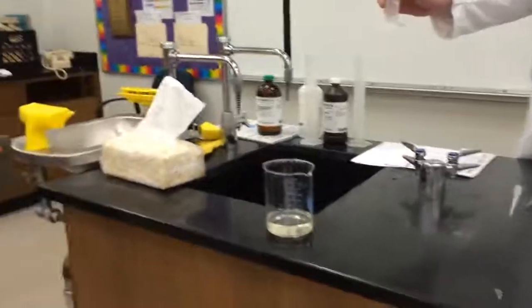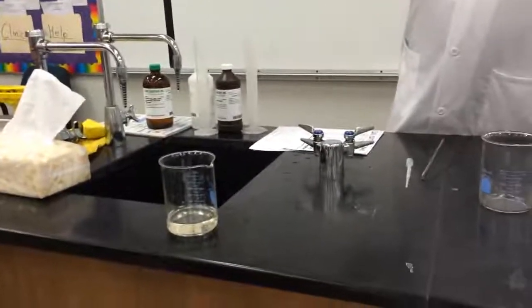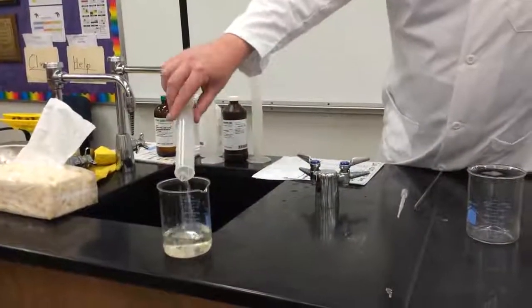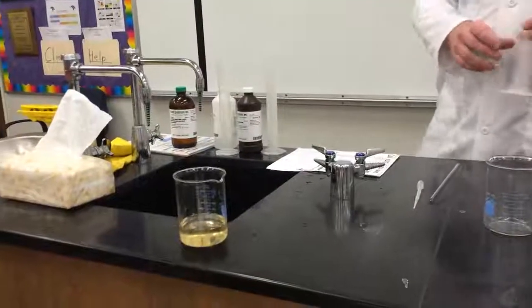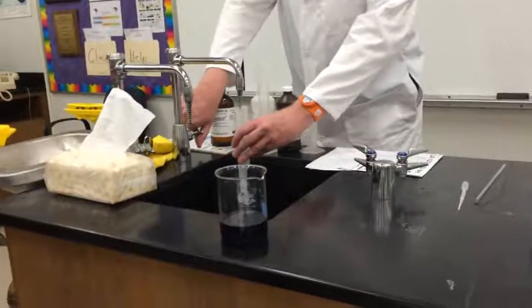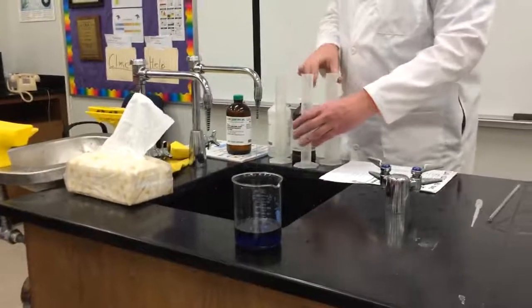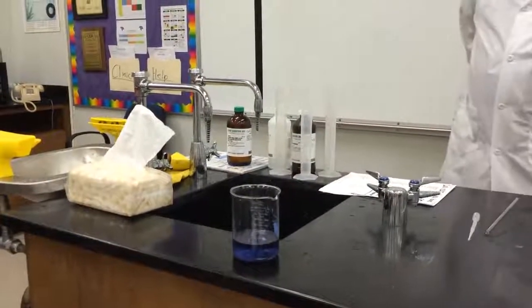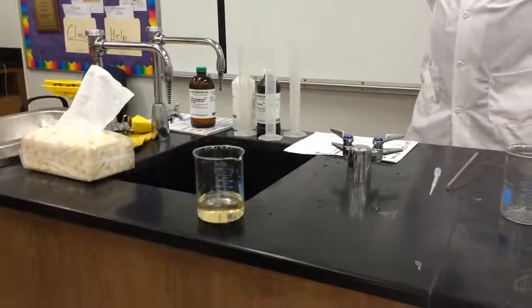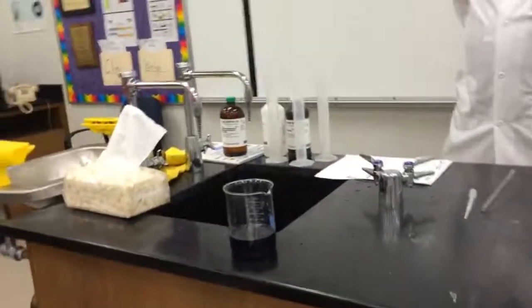Are you ready? Okay, so one of the signs of a chemical reaction is that there's a color change. Tell me what color or colors you see here. Call them out. Yellow. Yellow. Wait for it. Blue. Green. Not yet. Not here. Purple. Purple maybe, yeah. Purple. Purple. That's clear. Really green. That's yellow again. Green. Blue. Oh, that's so cool.